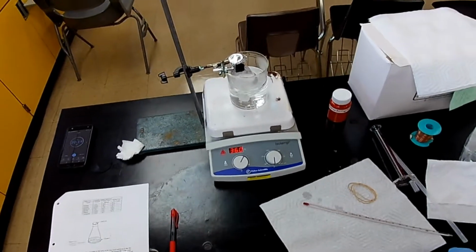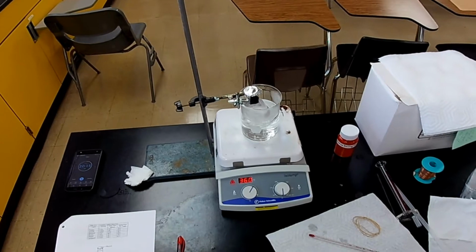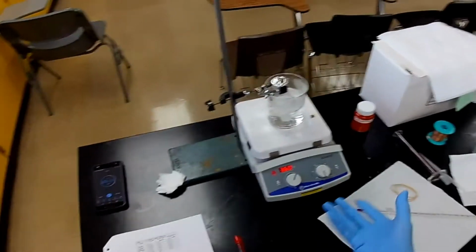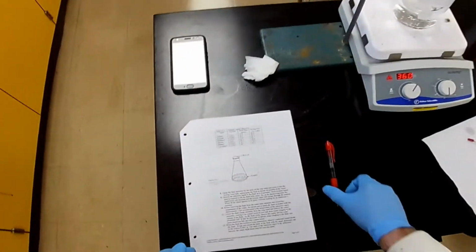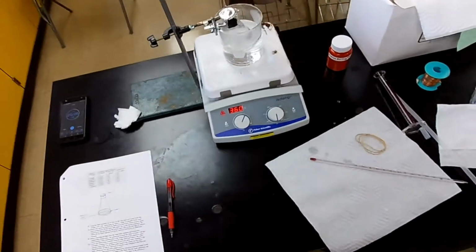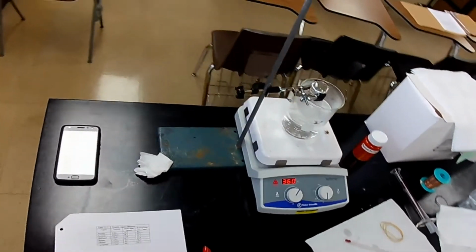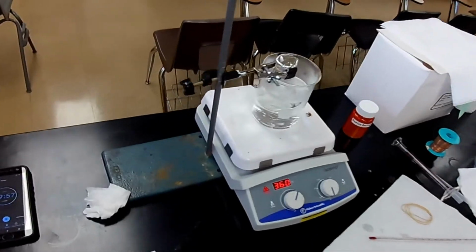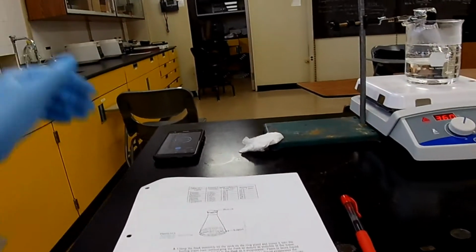And the colored compound, once all the liquid is gone, the colored compound is also gone, and it goes from a color to colorless. And then you know that you've got only vapor in there. But this is only a community college, so we can't afford that stuff. A little tiny bottle is like $100. So we're just going to give it some time.